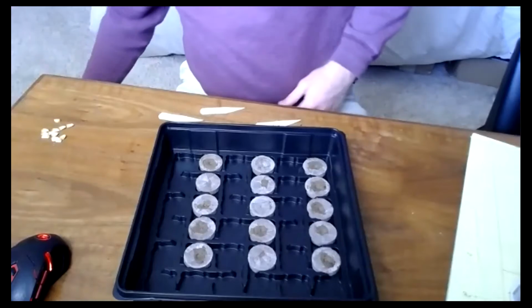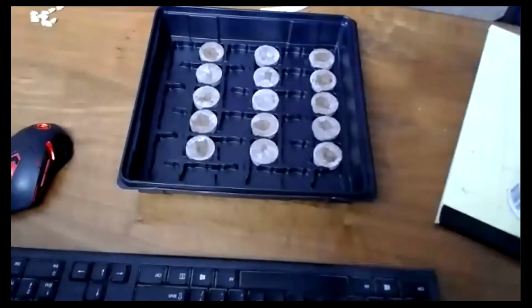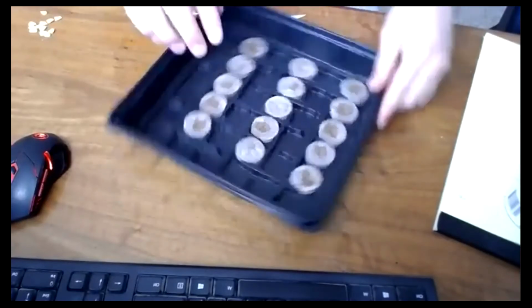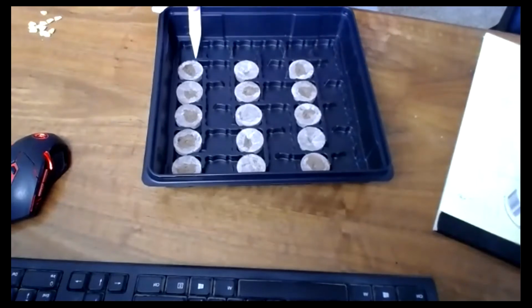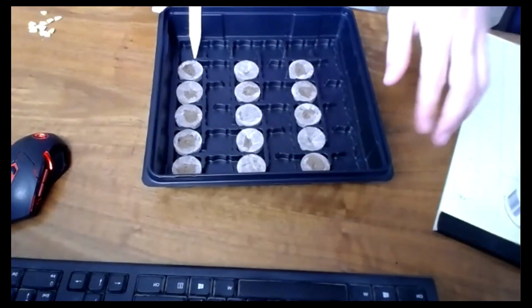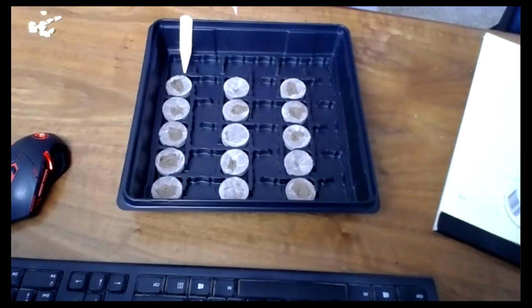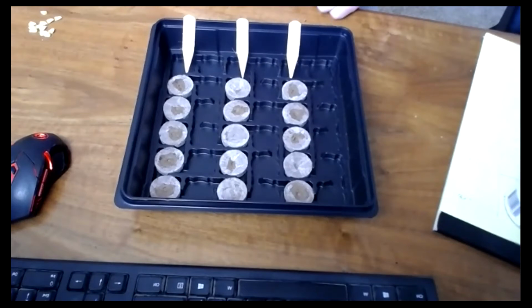All right, now we're going to actually set up this experiment for real. Let's see if I can, there we go. I've got 3 rows of pots. I'm going to actually just turn these for you. I've got 1 row for treatment number 2, 1 row for treatment number 3, and a row for treatment number 10. These are according to, remember, experiment number 2.